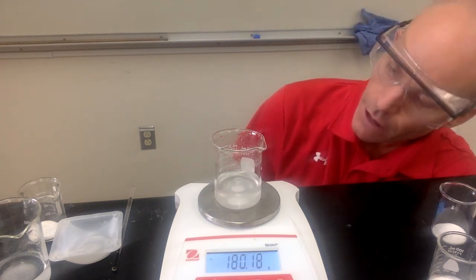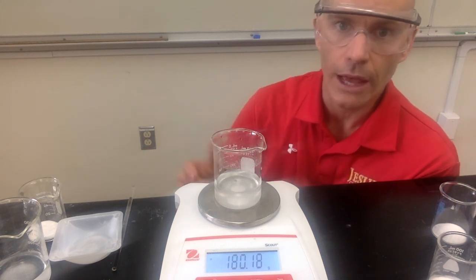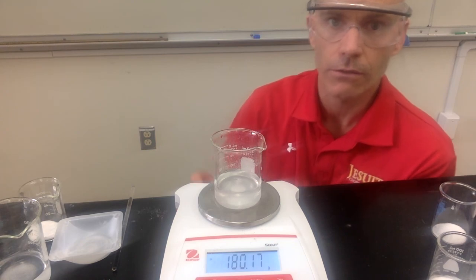All right, it looks like that's done reacting. Not too many more bubbles are popping there. So you can record that final mass, and then you should have all the information you need to complete the calculations. All right, that's it.